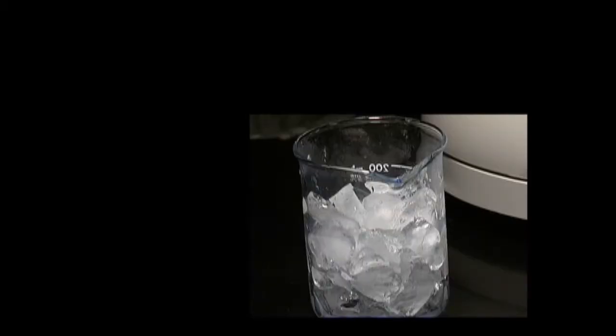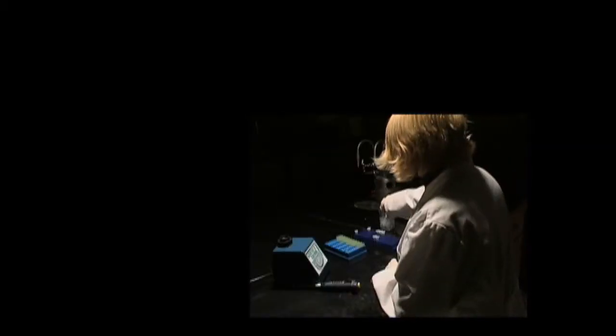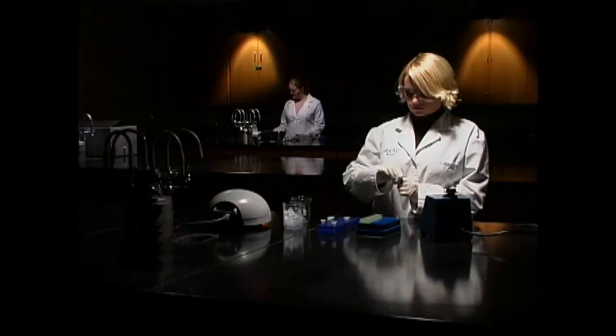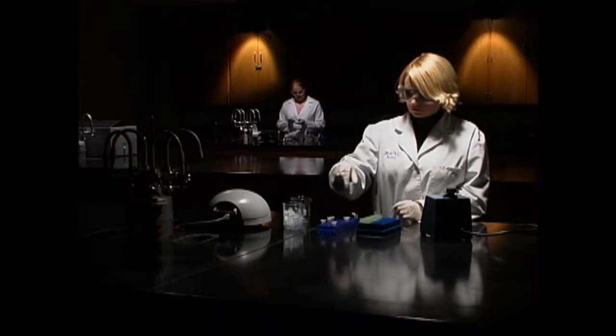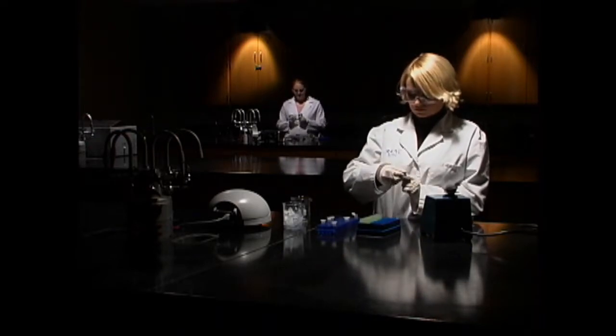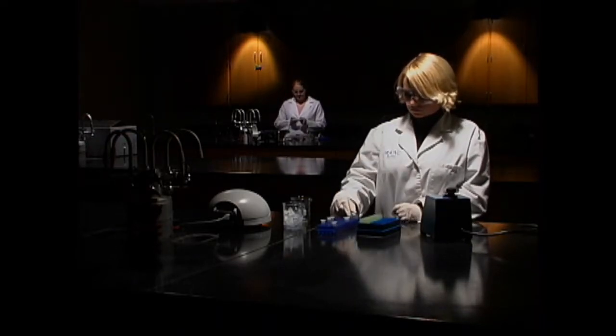Keep the solution on ice for 5 minutes. Add potassium acetate neutralization buffer using a pipet. The acid will neutralize the basic sodium hydroxide, and the cold will cause potassium salt to precipitate, removing the SDS from the solution.